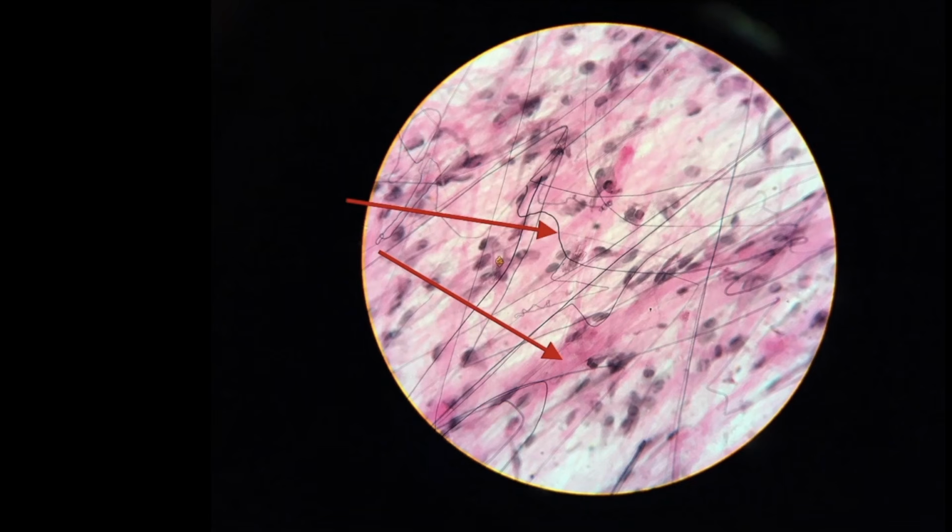All right, this one in my opinion is the coolest. It looks like somebody took a cardboard box, put some marbles in it, put some different color paints in there, and shook the cardboard box around and let the marbles float around. That's what that looks like to me. You got all kinds of different fibers. We have that pink broad in the background. That's once again collagen. But then you also have these elastic fibers, these hair-like fibers. That's elastic. This is areolar connective tissue.